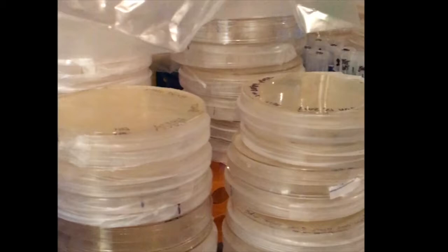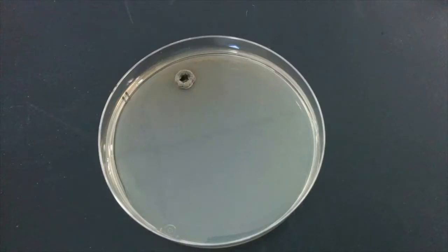Plates should be stored in an inverted position to prevent water from pooling on the agar. This water may encourage fungal growth and can cause difficulties when preparing the plate for use. Wet plates can be placed at 37 degrees to dry before use.